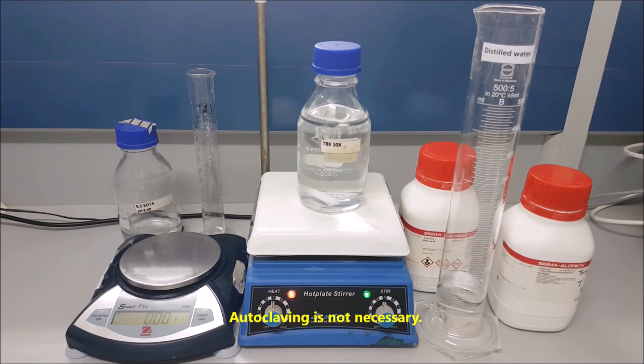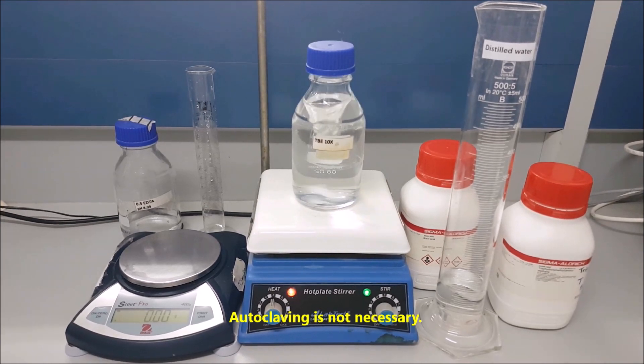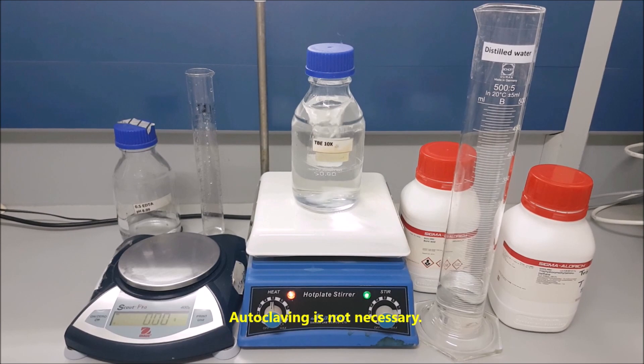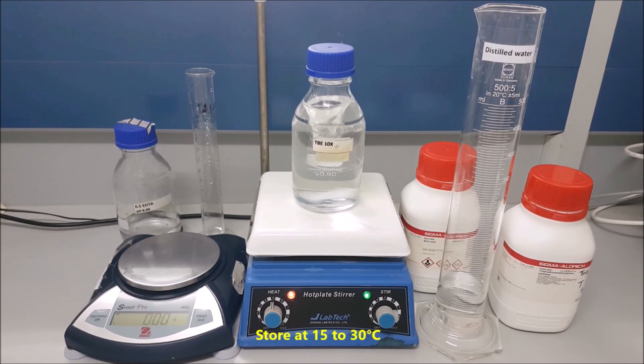Autoclaving is not necessary. Store at 15 to 30 degrees centigrade.